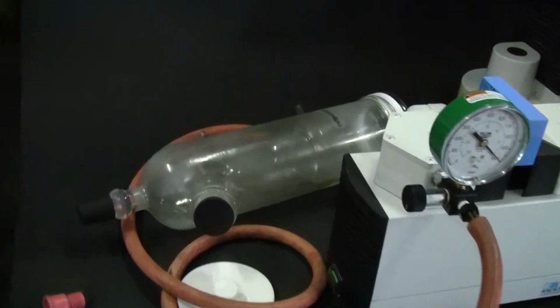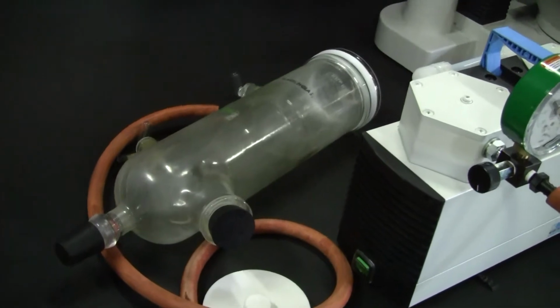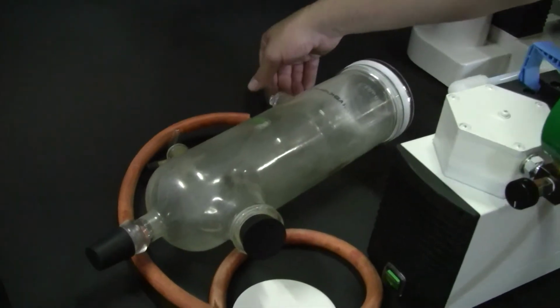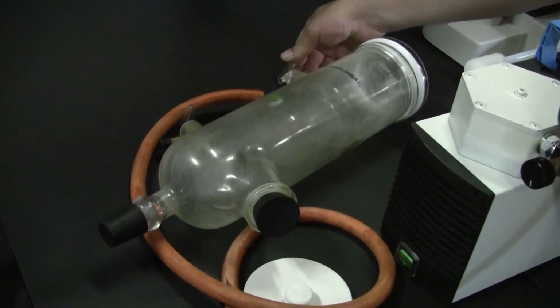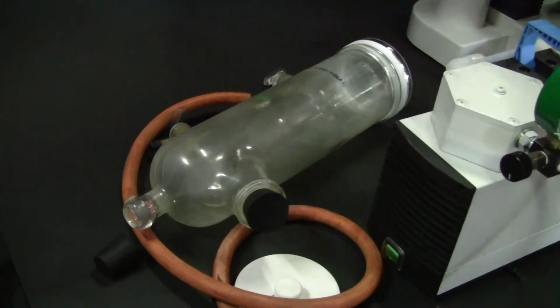If it wasn't holding vacuum, that rubber stopper would fall off. And I'm going to do that manually by putting the stopcock in to let air in it. And there we go. Thank you.